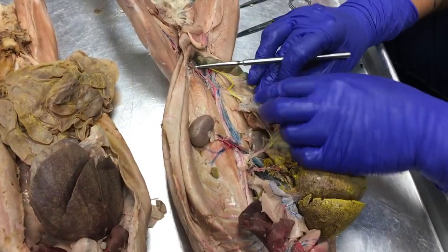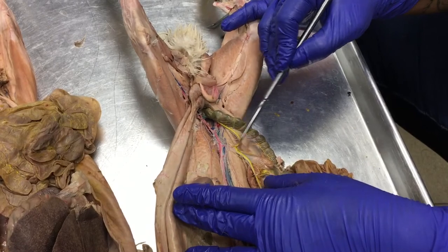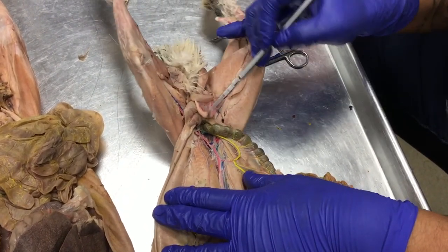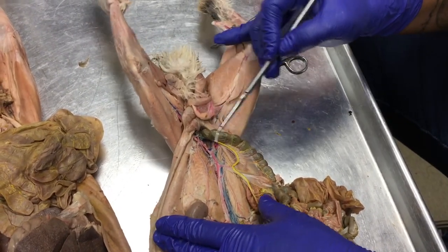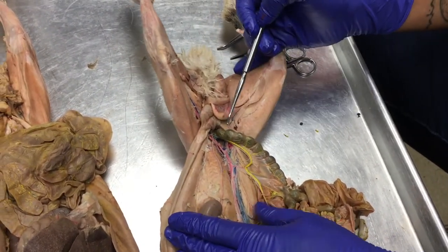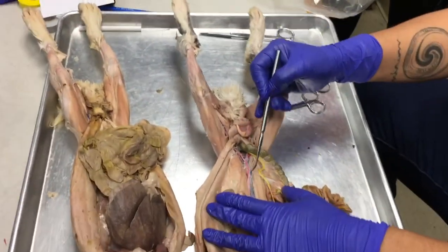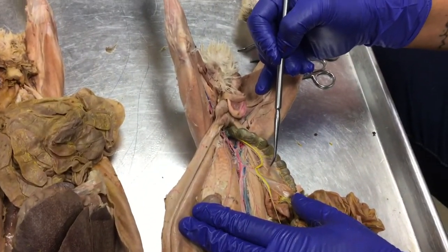Next, what we're looking for is our inferior posterior mesenteric artery, but it looks like my testicular arteries, this is a boy, are branching off in a couple of different places. Usually they branch off pretty symmetrically, anterior to the inferior mesenteric artery.